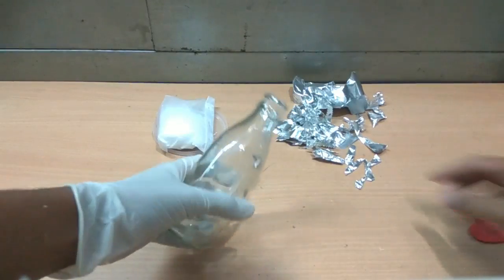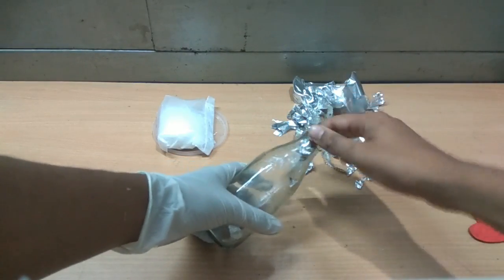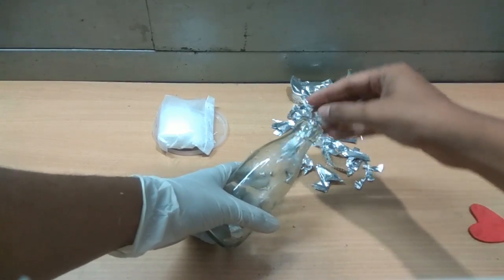This is aluminum metal. You can either use aluminum foil or old aluminum wire. Cut the metal into small pieces to increase the surface area, as this will help in faster reaction.